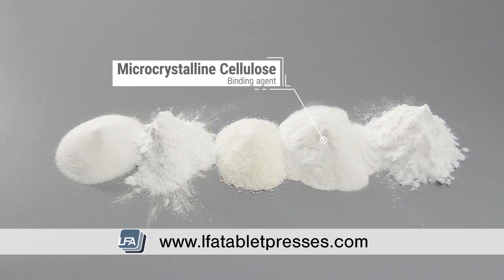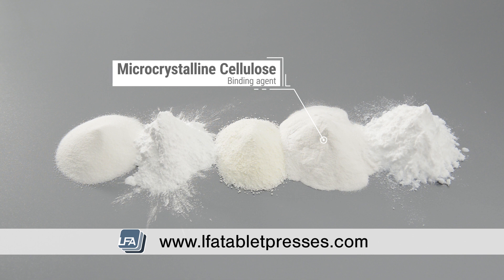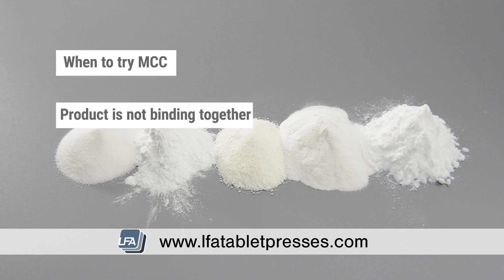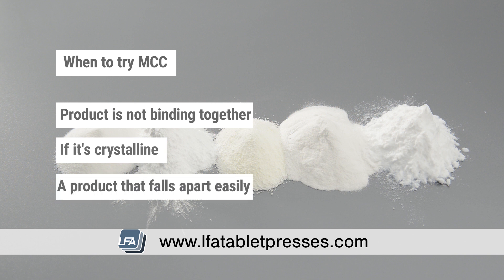Microcrystalline cellulose, or MCC, is your tablet's binder. As well as being an excellent binder, it's insoluble and acts as a disintegrant, so it will release the tablet's actives on contact with moisture. MCC is a naturally occurring polymer that's a great additive in pharmaceutical, food, cosmetic, and other industries. If your product is having a hard time sticking together — say if it's crystalline or falls apart easily — then you'll want to add some MCC.